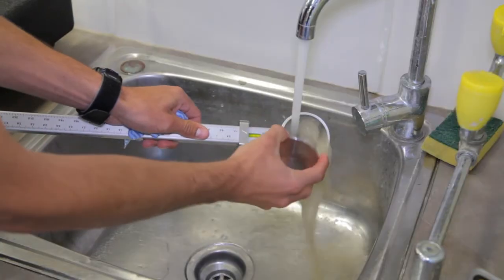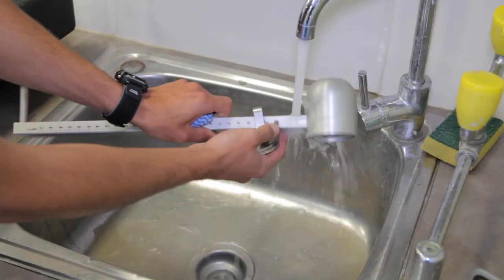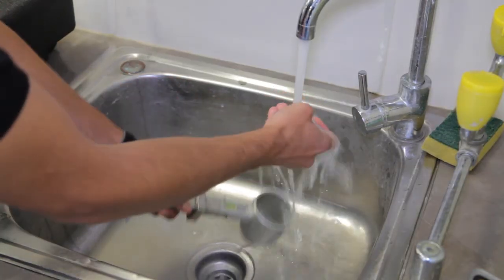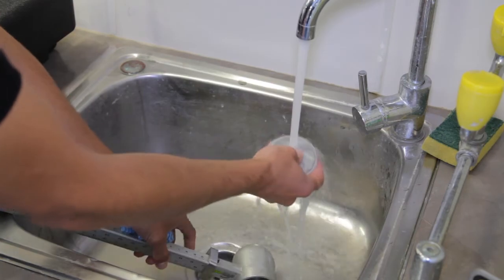It is recommended that the entire balance be cleaned after each test to ensure the results are accurate.